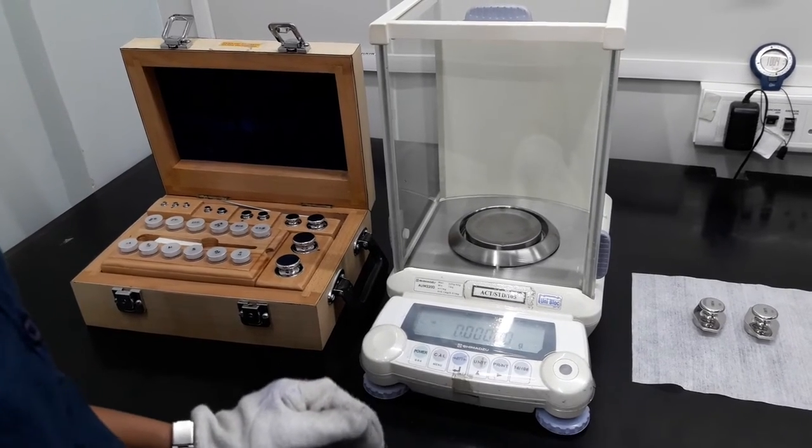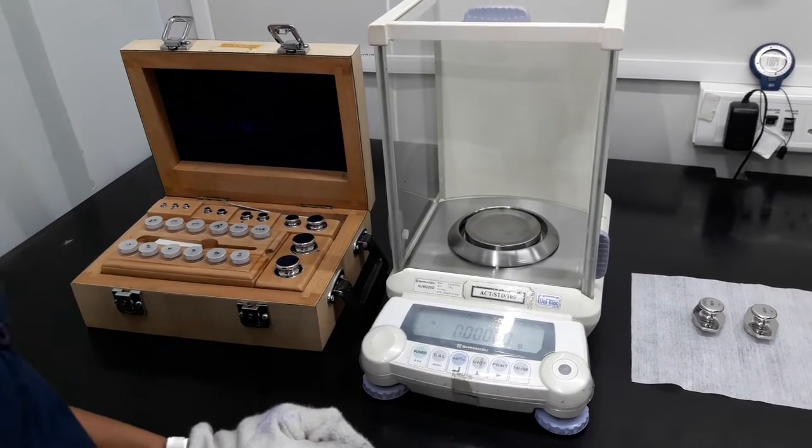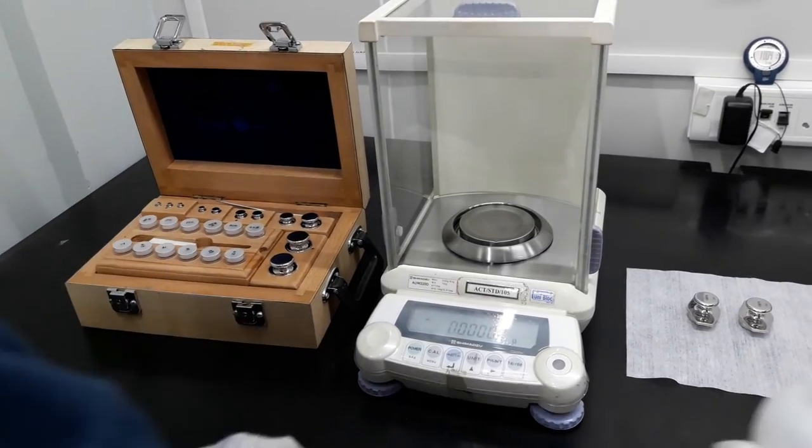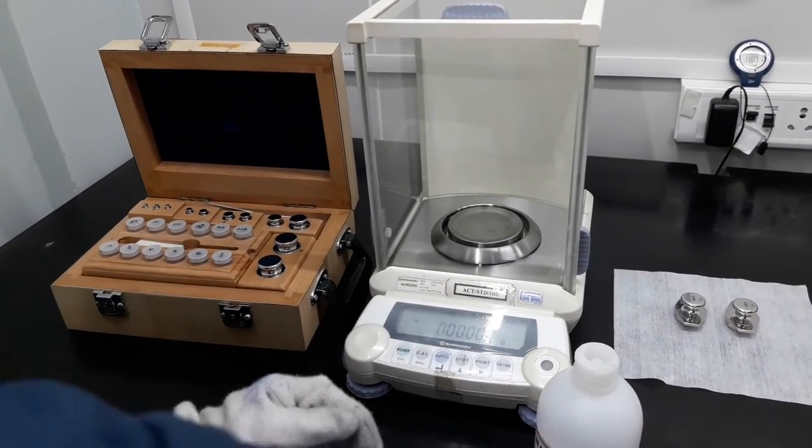Now let's start with the actual procedure. Weights have to be cleaned with acetone and soft tissue.